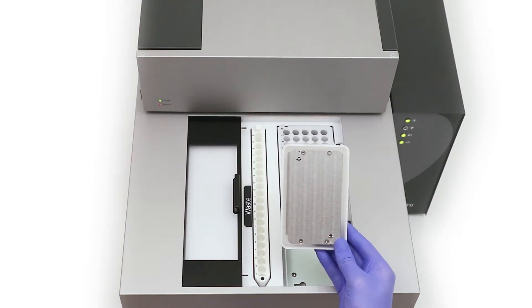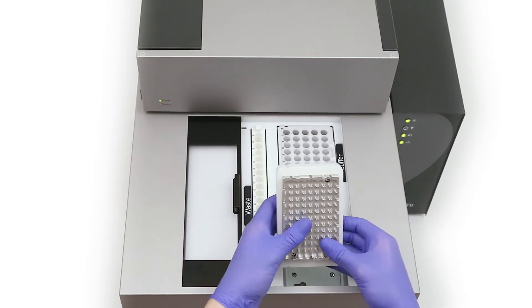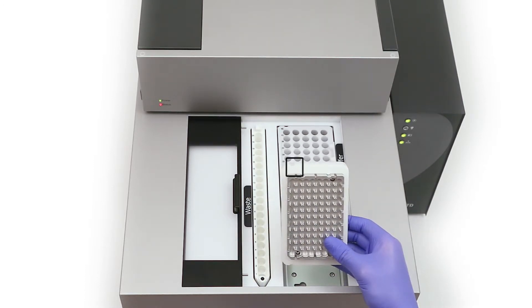Now turn the adapter over and insert it into the sample tray area of the autosampler. The groove in the top left corner must align with the capillary alignment post.